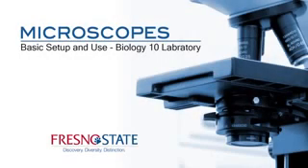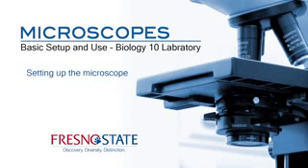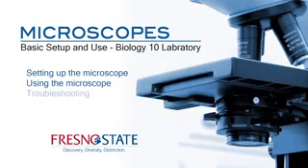This video demonstrates how to use the microscopes in the Biology 10 laboratory. It consists of 4 parts: setting up the microscope, using the microscope, troubleshooting hints, and cleanup.